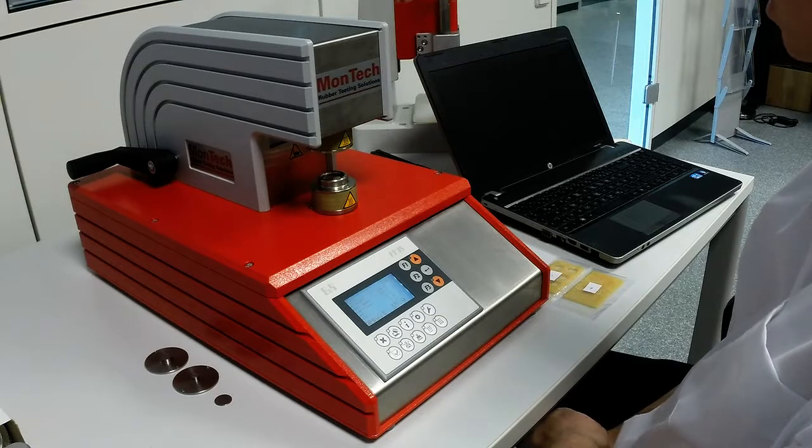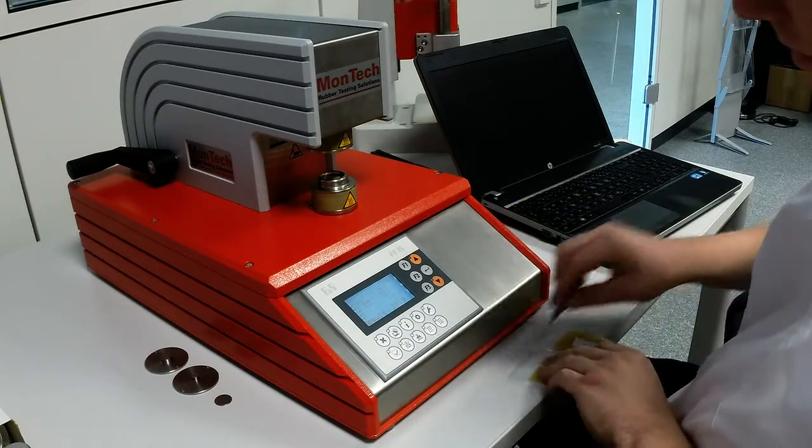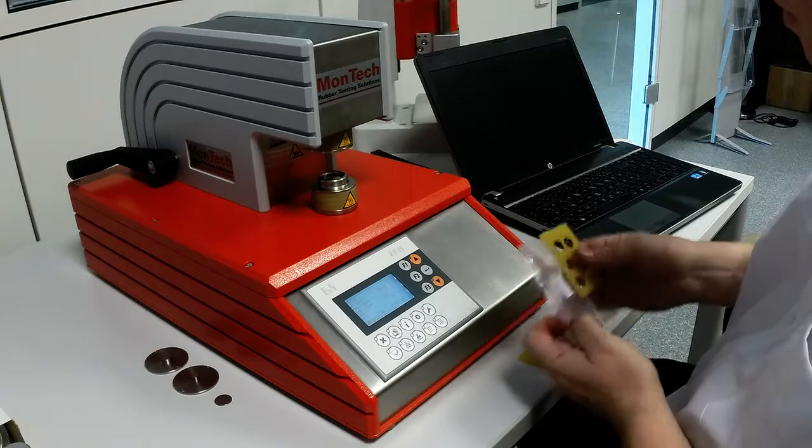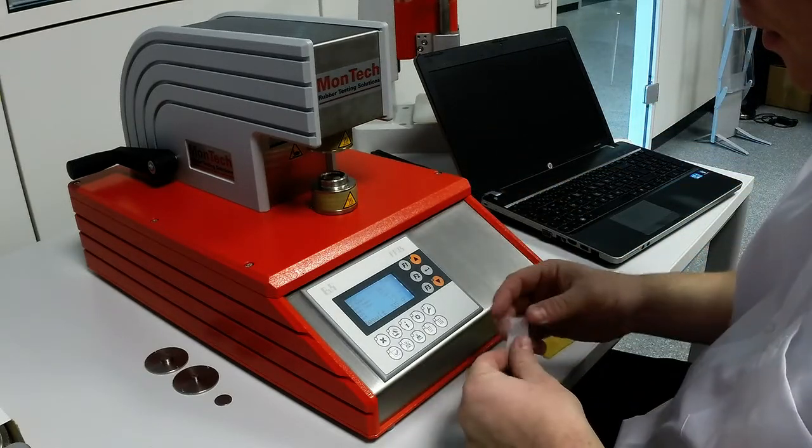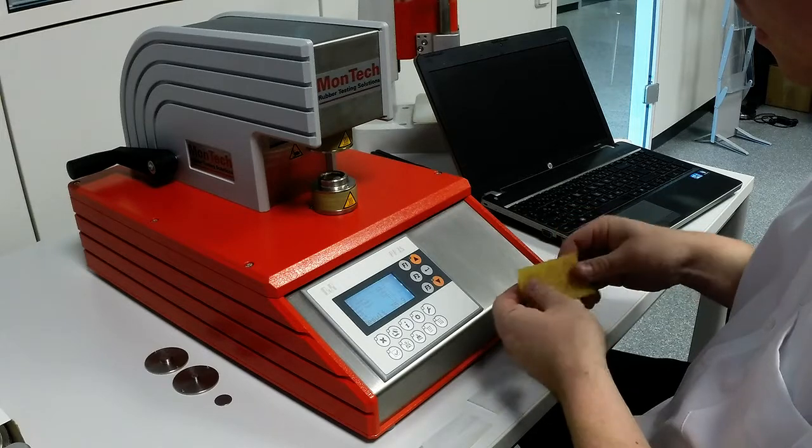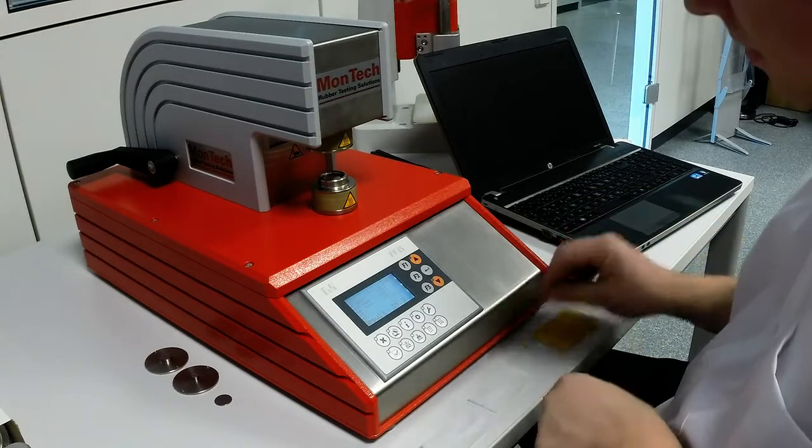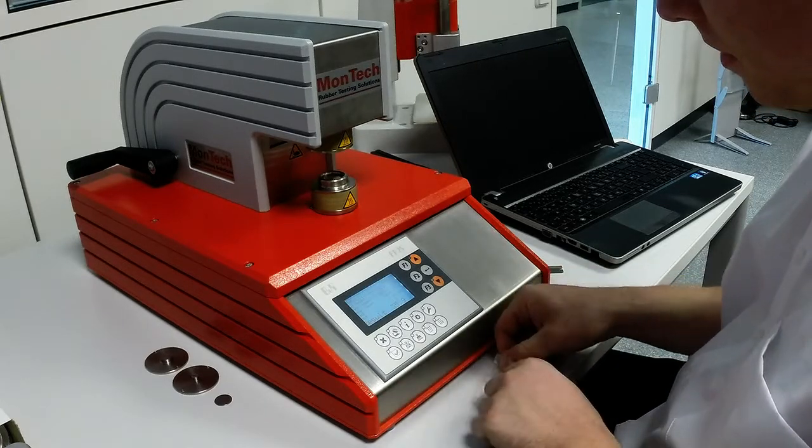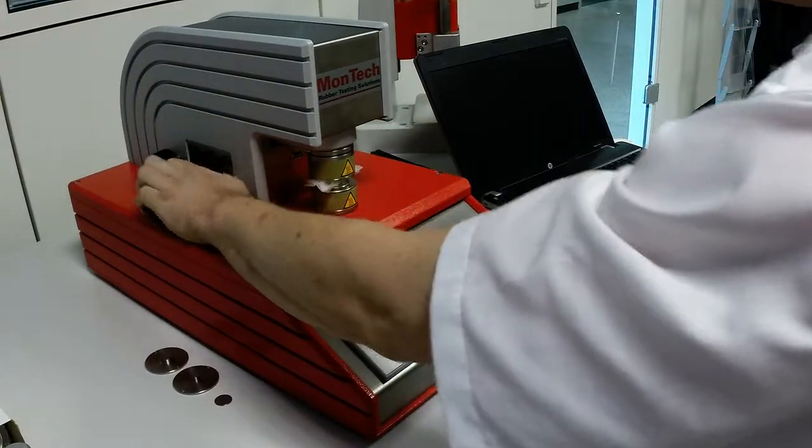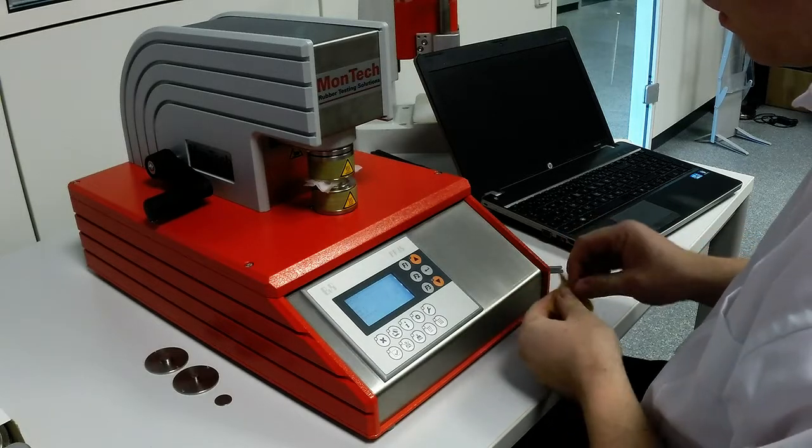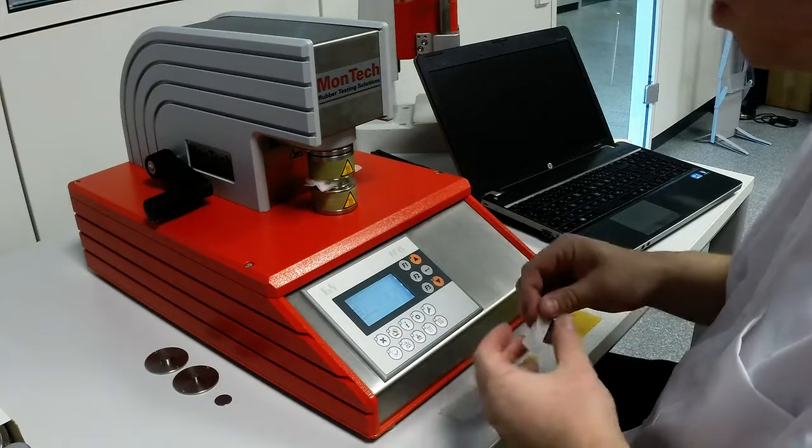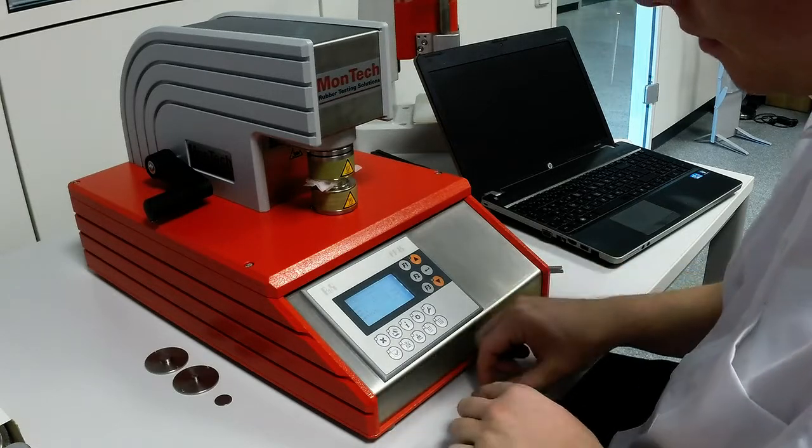Let's run a test series. CV60, sample 2. First sample. The instrument runs at standard conditions: 100 degrees centigrade, 15 seconds preload time, 15 seconds test time.